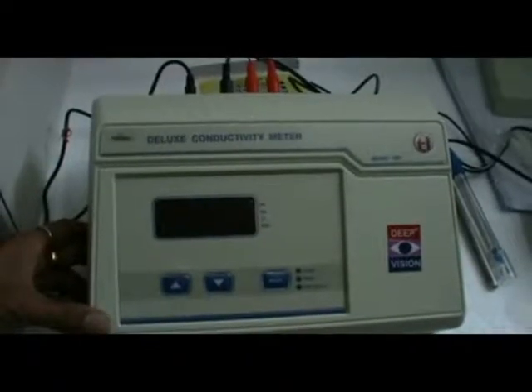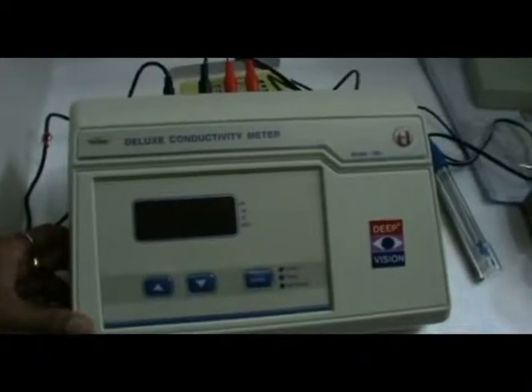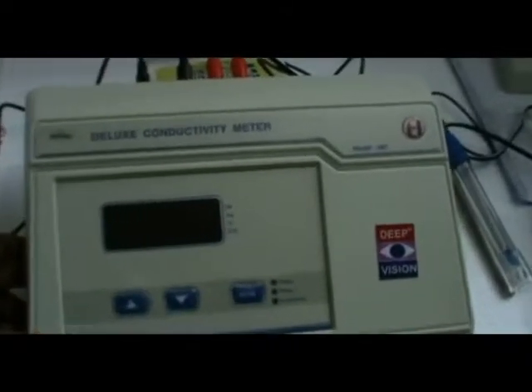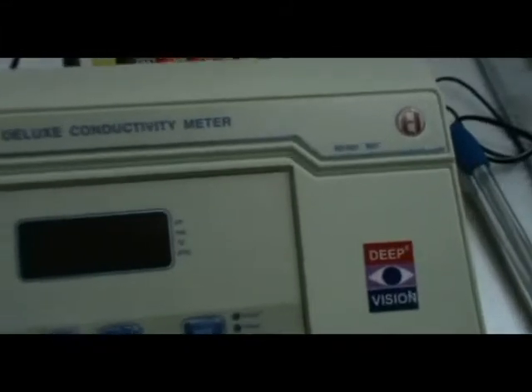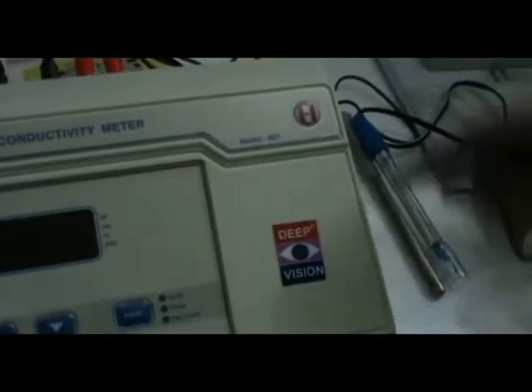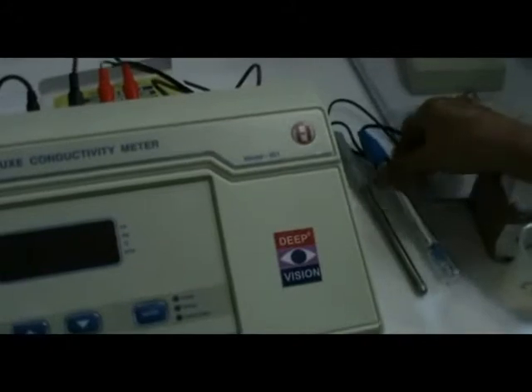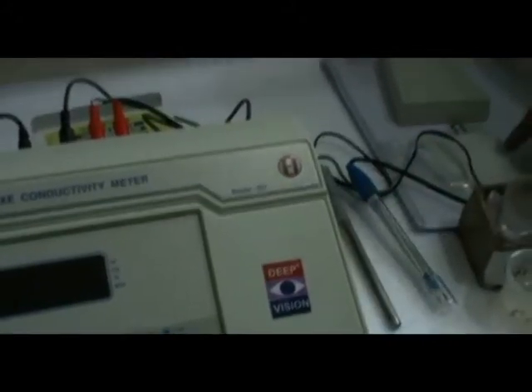Demonstration for conductivity meter Model 601 and 611. Accessories include the meter, conductivity probe, temperature probe, dust cover, electrolyte standard, and instruction manual.